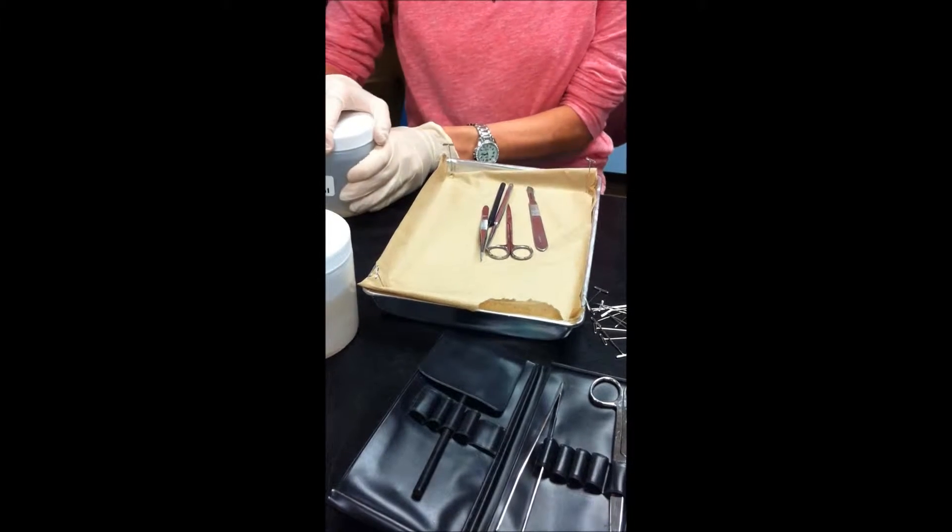These are your dissecting pins. There's a whole whack back there, so when you get started, just grab a bunch.